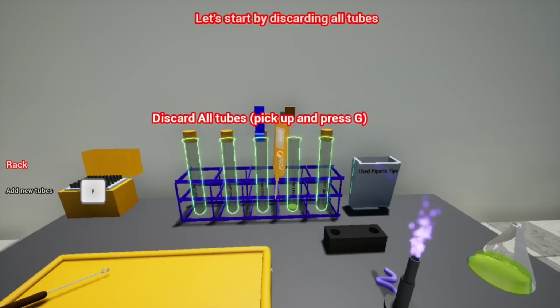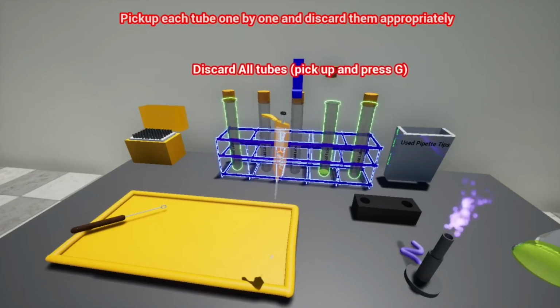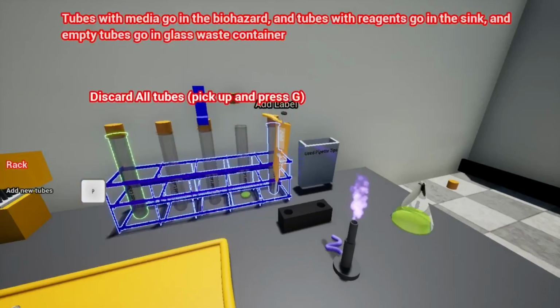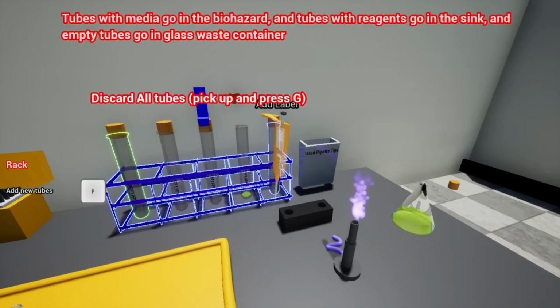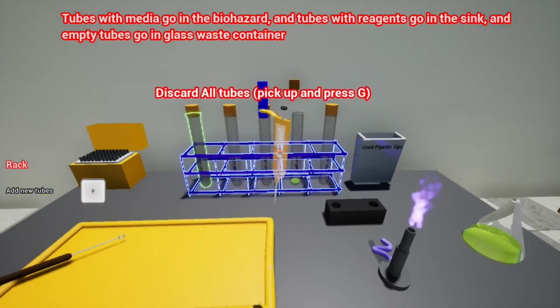Let's start by discarding all tubes. Pick up each tube one by one and discard them appropriately. Tubes with media go in the biohazard, tubes with reagents go in the sink, and empty tubes go in the glass waste container. Over here it gets a little bit tricky.